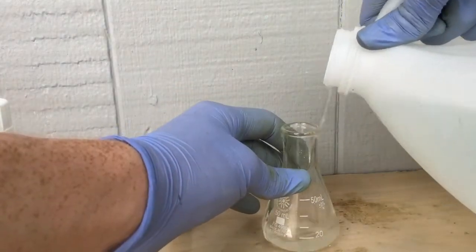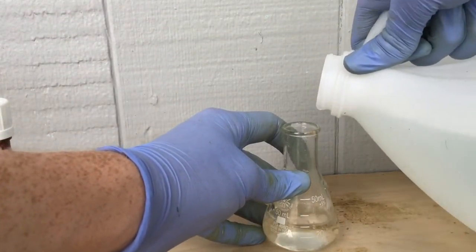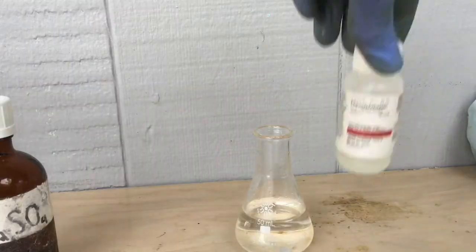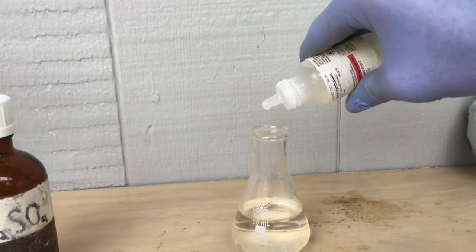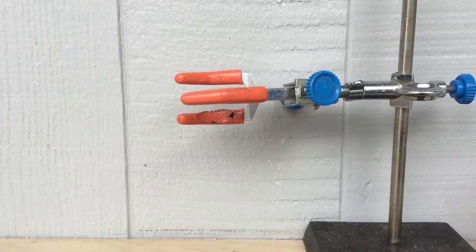I'm adding a little water so that we can see the color change better. Here's a little phenolphthalein, the indicator that will turn pink when it's completely basic and the reaction is over.